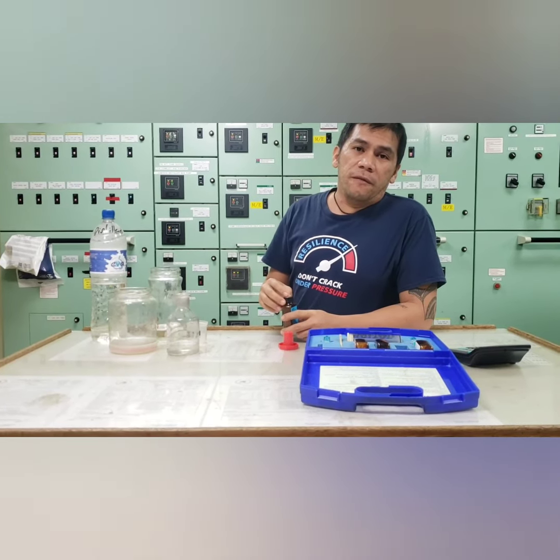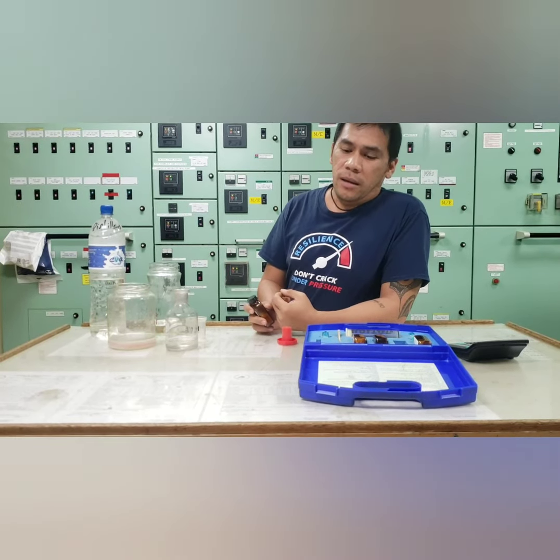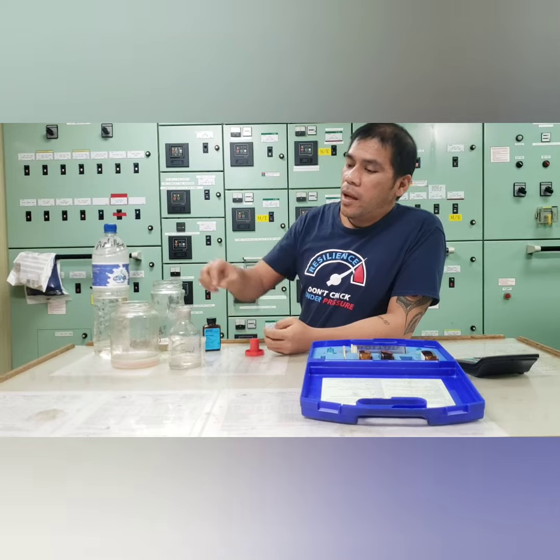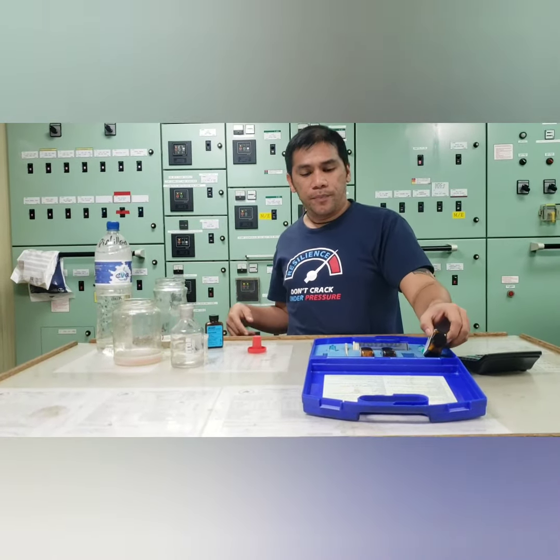The type of cooling system we have here is the open system, which is we use seawater as a cooling medium. Not like the closed circuit, which is the seawater is the only medium for central cooling, in which the jacket cooling system was cooled by the low temperature fresh water. So now we will going to take the chloride test for our system.